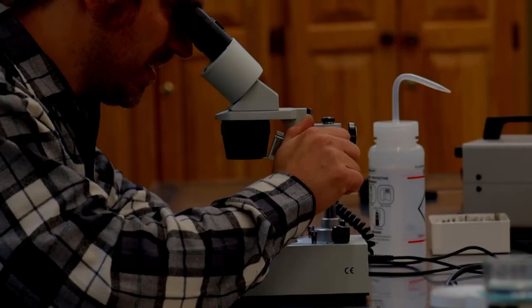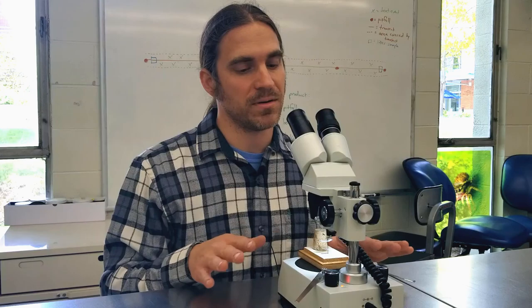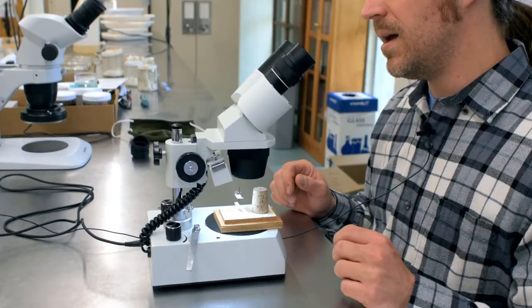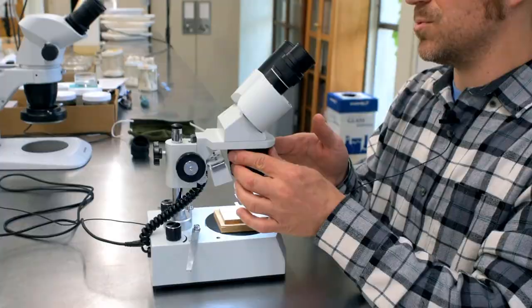One issue that students first using microscopes often run into is how to even find the specimen under the microscope, especially if it got bumped and adjustments are offset. To find a specimen, check all the adjustments. First, I notice the zoom on this microscope is on 4x, which is too zoomed in — it's useful once you have the specimen positioned, but for now we'll adjust back to 2x.